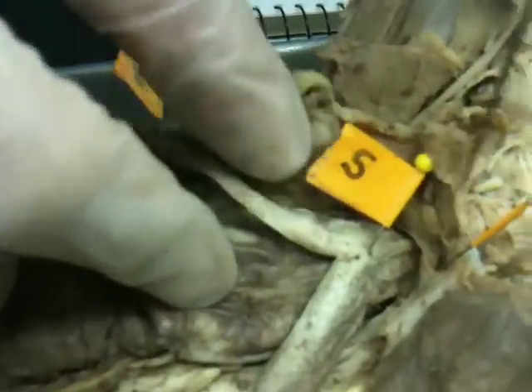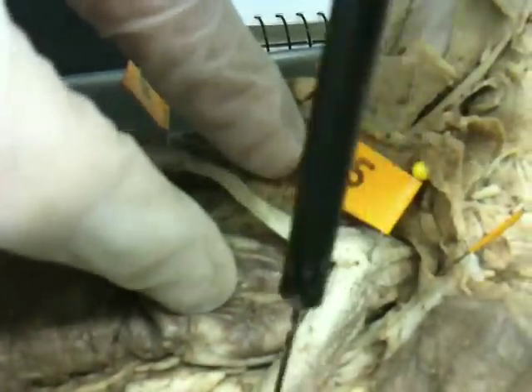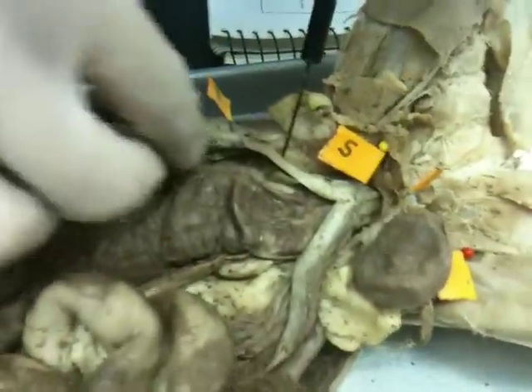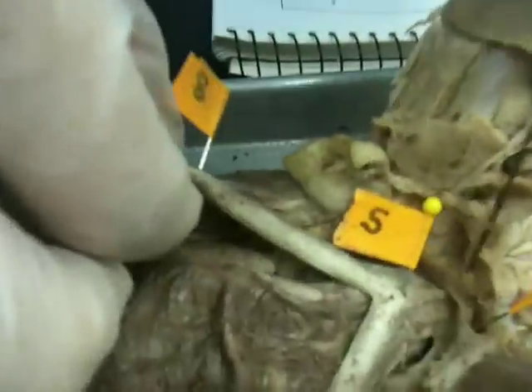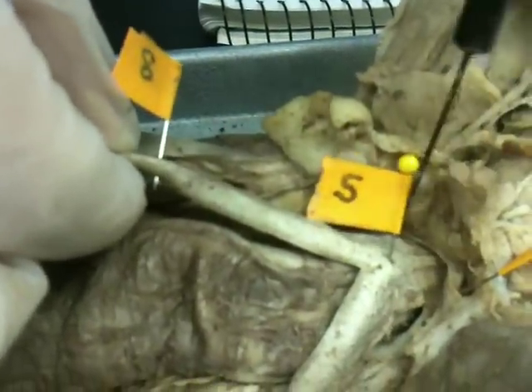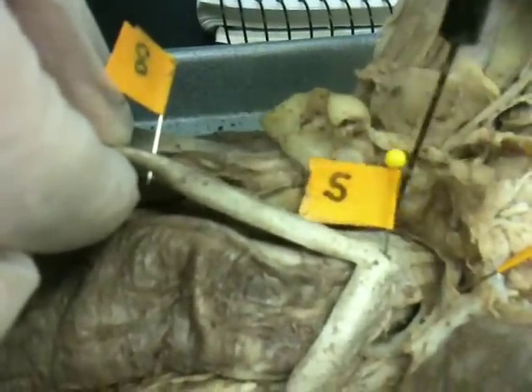Here we have the body of the uterus. It starts here with the body of the uterus, which is number 5.